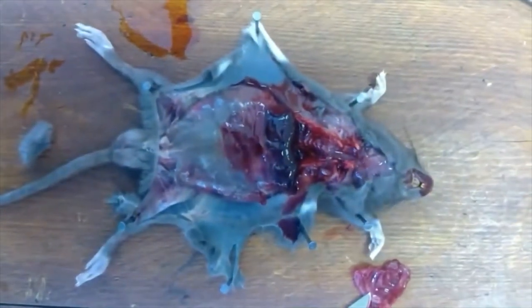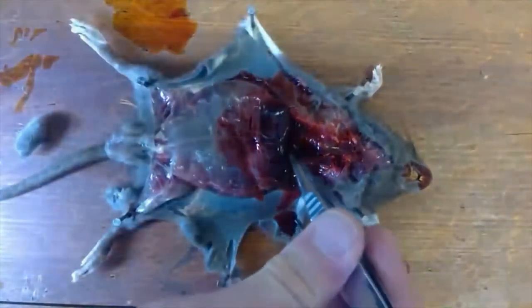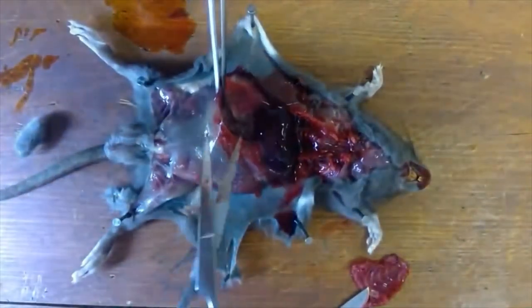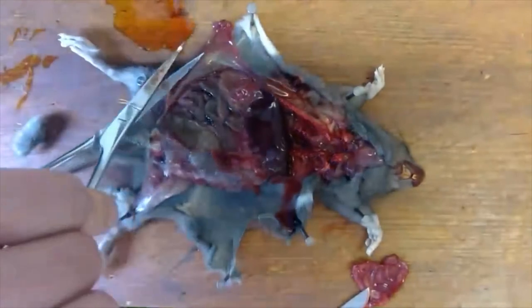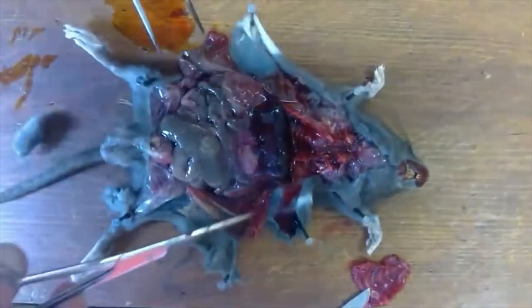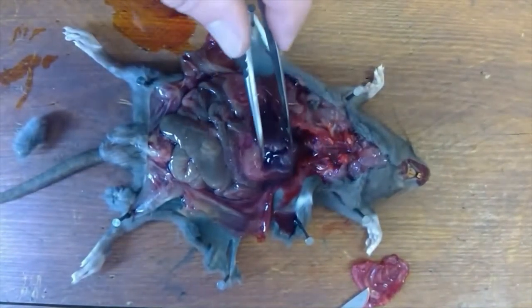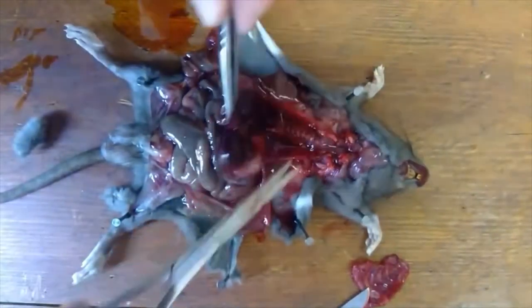Let's have a close look at the digestive system. The first organ you see — this big dark organ at the top — is the liver. The liver plays a really important role in digestion because it produces bile, which is important for the digestion of fats. Bile emulsifies fats, breaking them into smaller droplets, giving a large surface area for enzymes to digest those fats into monoglycerides and fatty acids. However, rats don't have much fat in their diet and therefore do not have a gallbladder — so we could look for one but wouldn't find it.